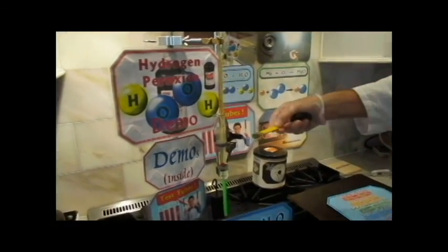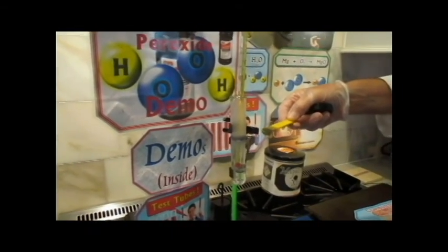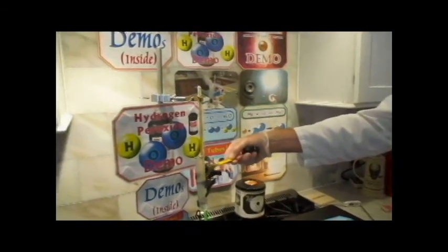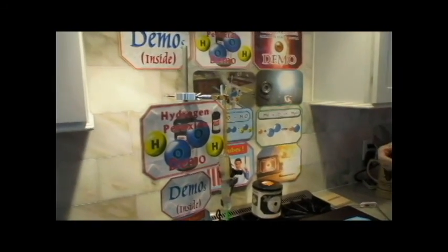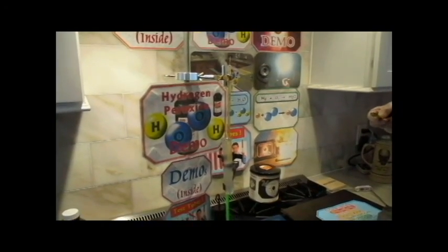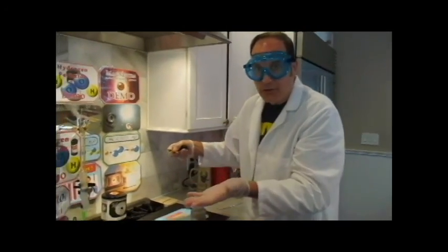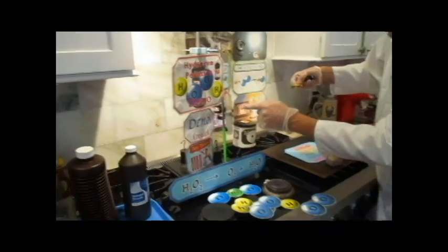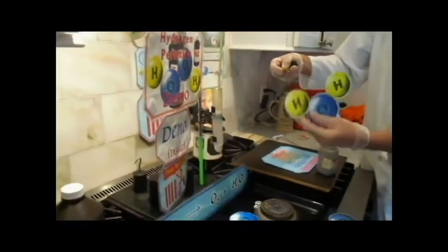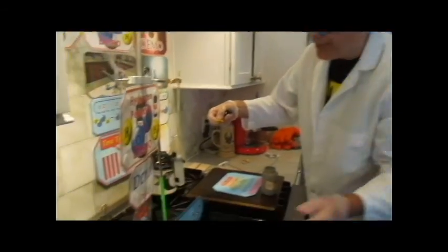So watch, I'm putting a little more in, a little bit in. Now notice, we see a reaction. It's happening way faster now because of the catalyst. Also, you see some sort of fog developing there. So that looks like that should be oxygen, right? But actually, oxygen is completely invisible. Think about it. You're breathing oxygen right now. You can't see the oxygen in front of you. So oxygen is invisible. What you're actually seeing there, what you almost always see when you think you're seeing a lot of gases, it's actually water. It's actually water turning back into liquid in the air.